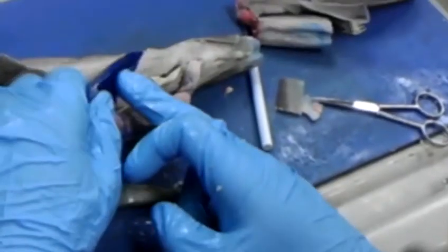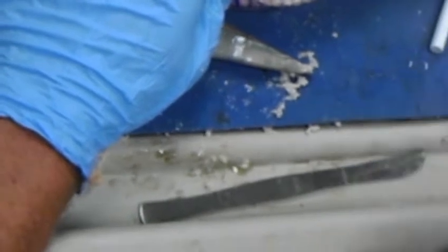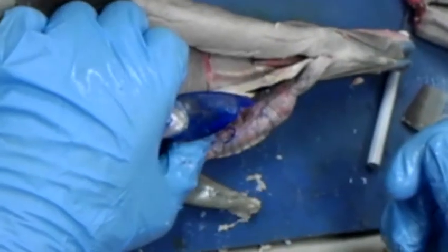Another organ that we find in here is the spleen, really bright red in a fresh fish, and this is where red blood cells are made. We make it in our bones, but that's a secondarily derived place that you make it. And the spleen is where fish make it. We can live without our spleen, a fish cannot.